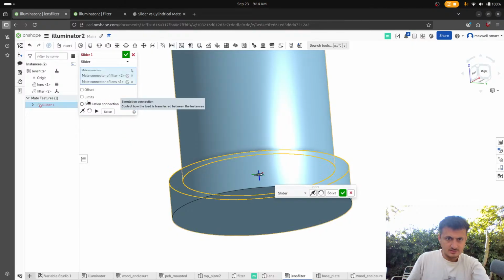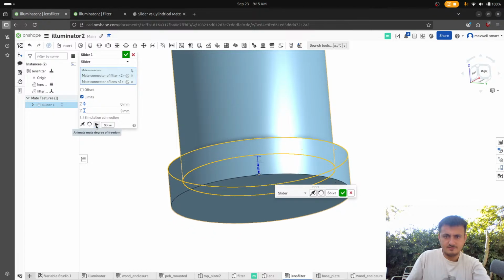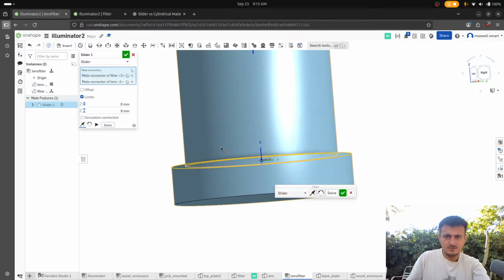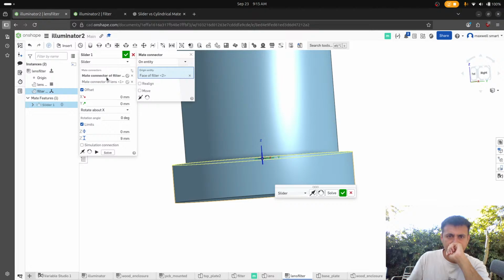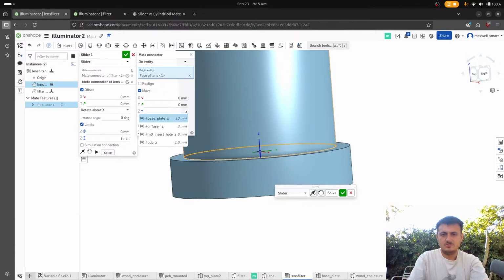And then we want the limits. So the Z. So I think we want this and then 9, right? So if I play this now, and then we just want to flip this. Oh wait, that's not what we want. Um, oh, I think wait, I think that this should be fine. We just need to take this. Or wait, travel.